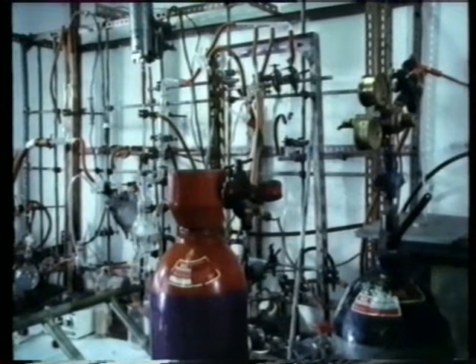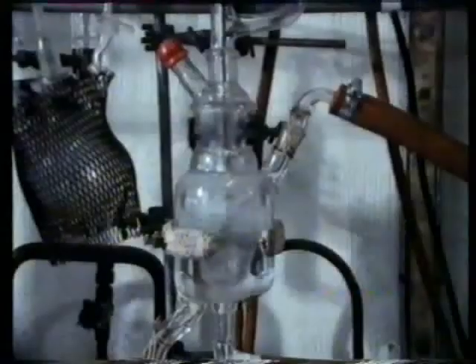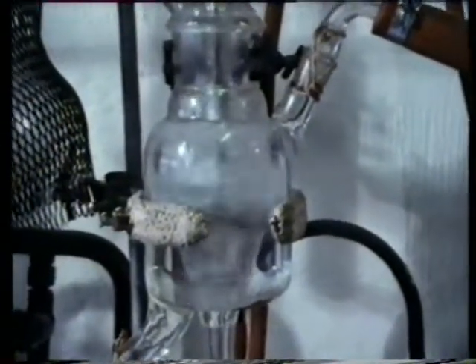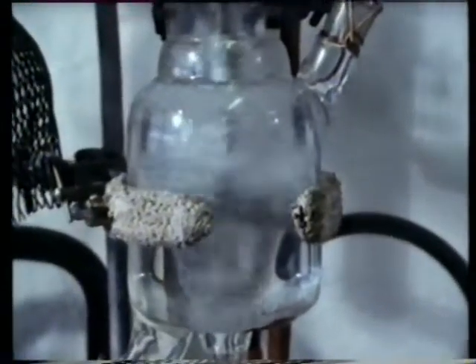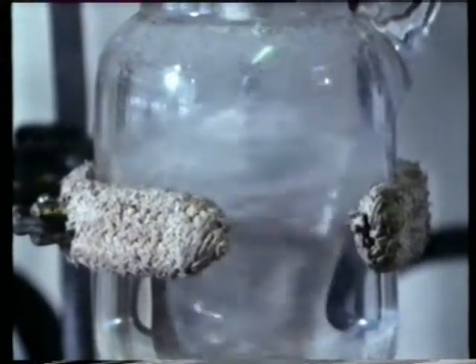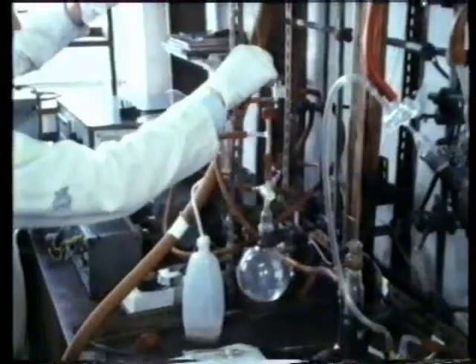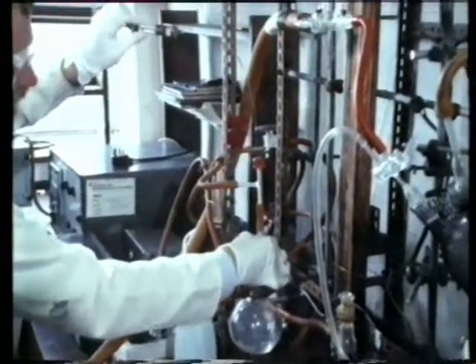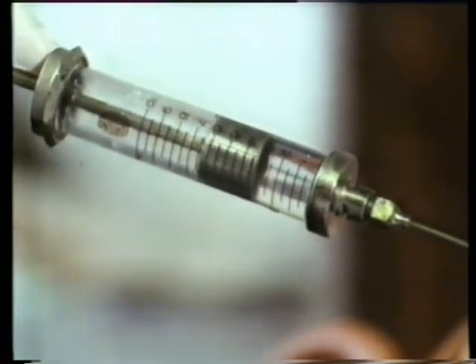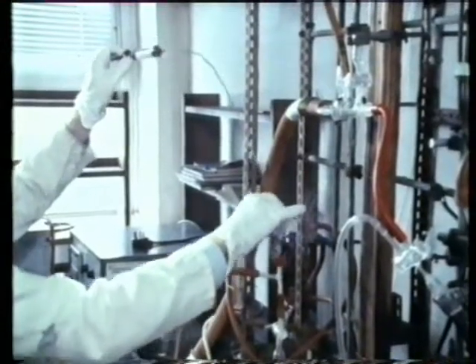Now, many other chemical elements and compounds will join onto ethene, and in fact, ethene will join onto itself. Here's a demonstration in the laboratory. This flask, which has to be completely free of air and water, contains a solvent, and ethene gas is being passed into it. If we add certain substances which act as a catalyst, ethene molecules will come together, joining onto each other to produce a new compound.